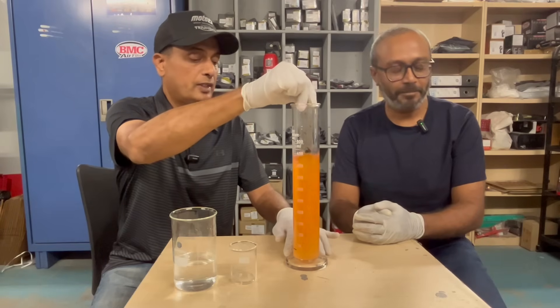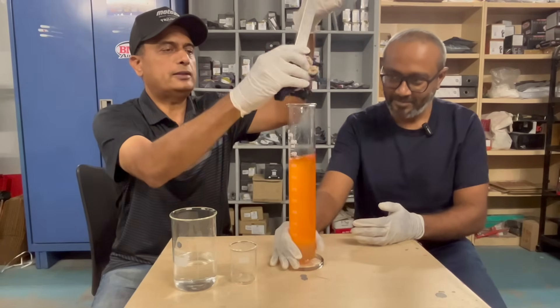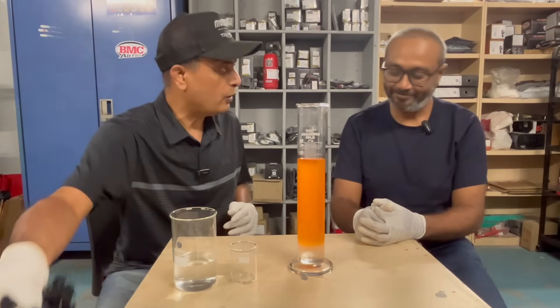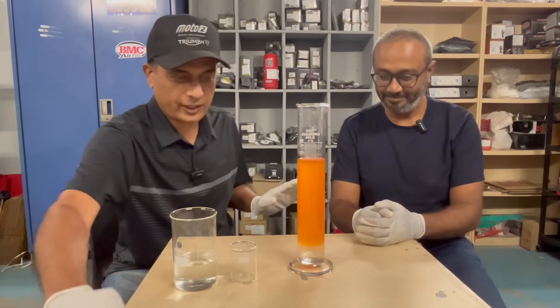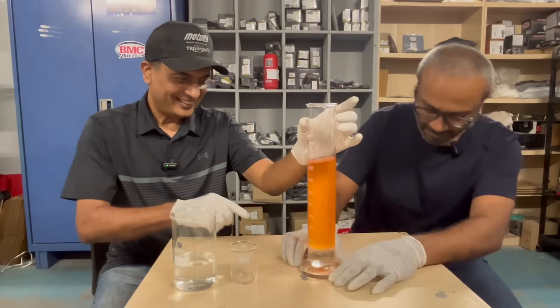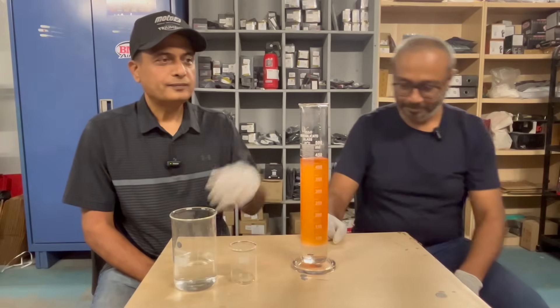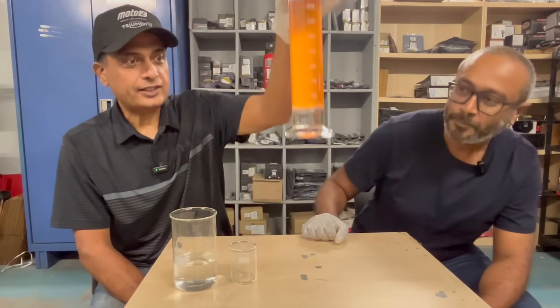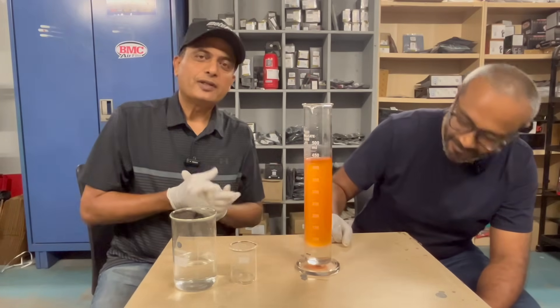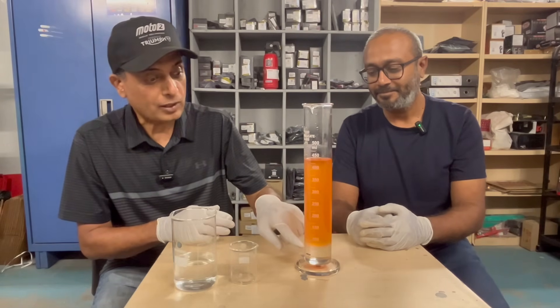I think we should be able to manage — this much of a stir is good enough for this experiment. You are conferred the doctor's degree for saving the measured cylinder! If you continue to keep quiet I will leave the doctor's degree with you. Let's wait. You can already see what's happening. I'll leave the marker here so you can see better. You can see the mark — see what's happened. We put in only 40 ml of water, it settled at the bottom, we gave it a good shake, and now it looks like there is about 80 ml of water.